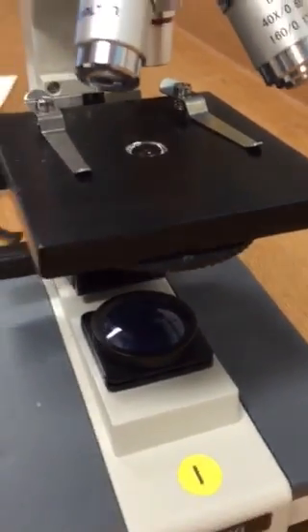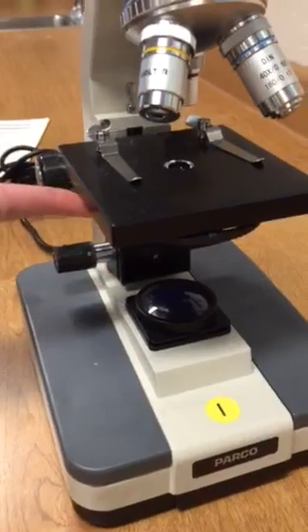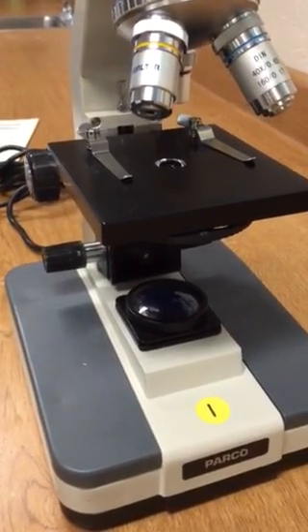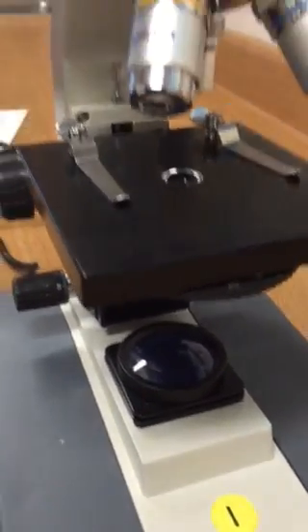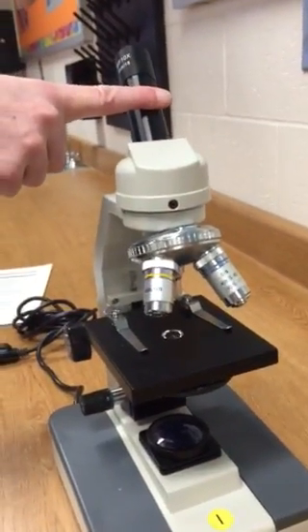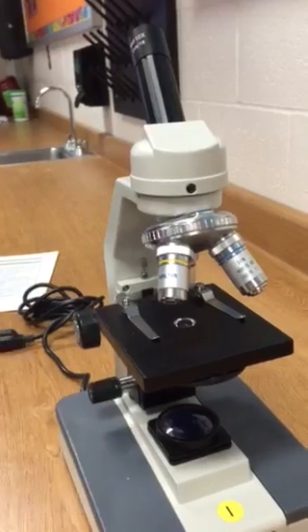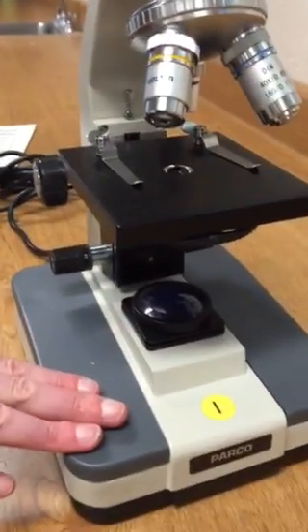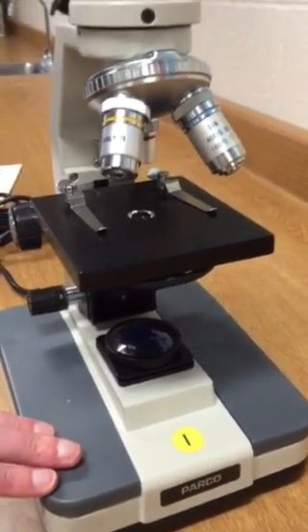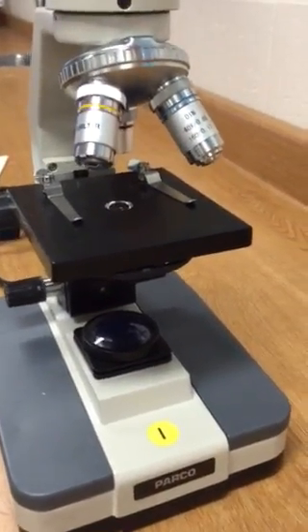The next part is the light source, which gives light to our specimen so we're able to view it better. If you look into the eyepiece and it's really dark and black, it's because your light is not on — you need to turn it on. And lastly, we have the base, which supports the microscope and keeps everything in nice working order. That is the parts of the microscope.